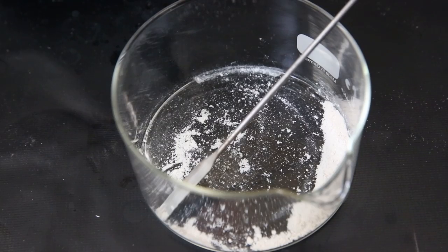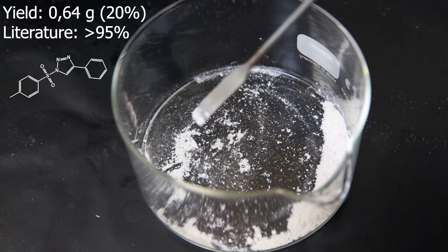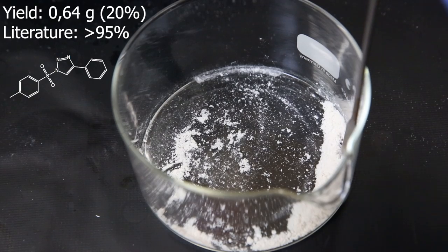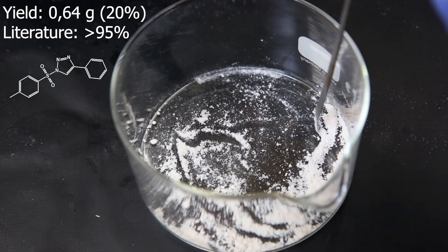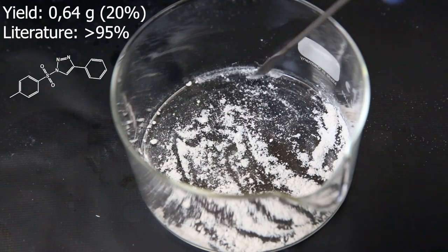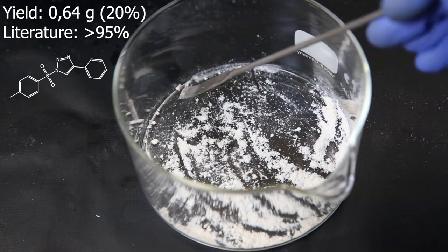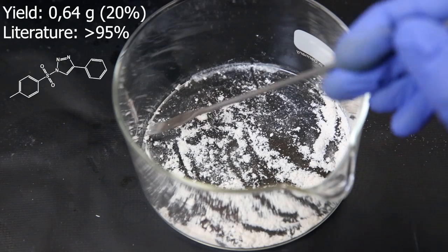Afterward, I scraped all of the solid off the filter and I am left with 0.64 grams of product. This corresponds to a yield of 20%, which is a lot lower than the high yields in literature. This isn't too surprising since I stopped the column prematurely because it was taking a lot of time to get through.